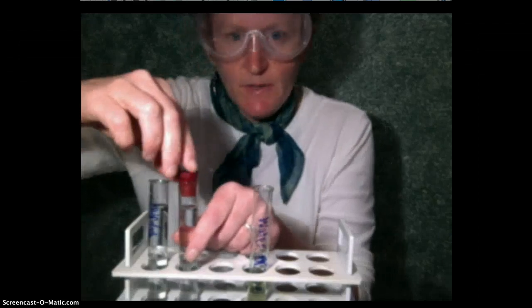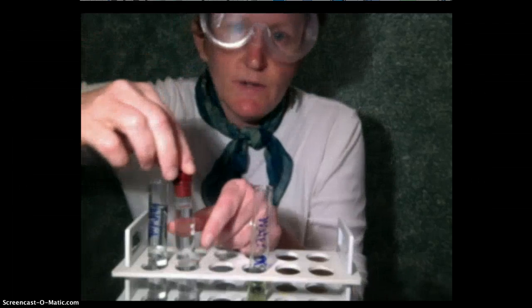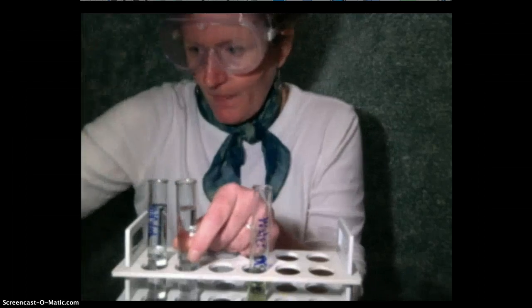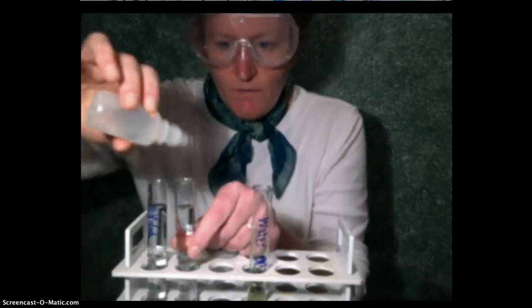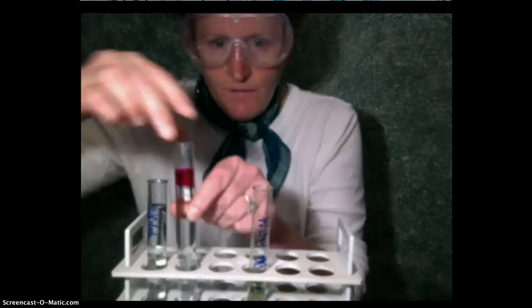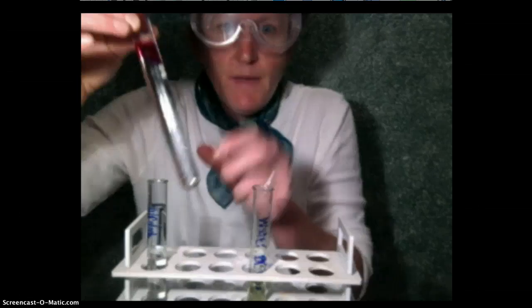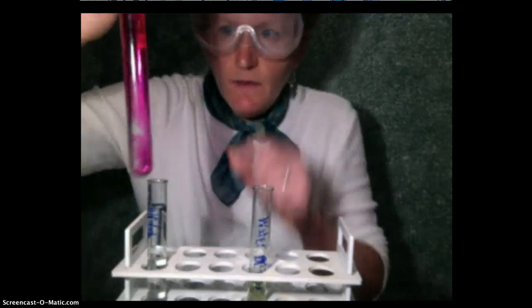Ammonia is very dangerous if you breathe it. In fact, it kills farmers in southern Minnesota because it's part of fermenting pig manure. So I'm just going to take the cap off very quickly. It's also a window cleaner, and it's a base. Phenolphthalein tells us about base. When I add phenolphthalein to the ammonia, you can see that there's a dramatic color change here. It's turning a lovely shade of pink.